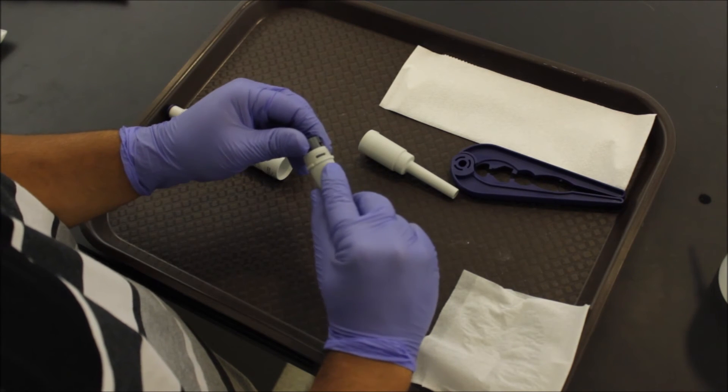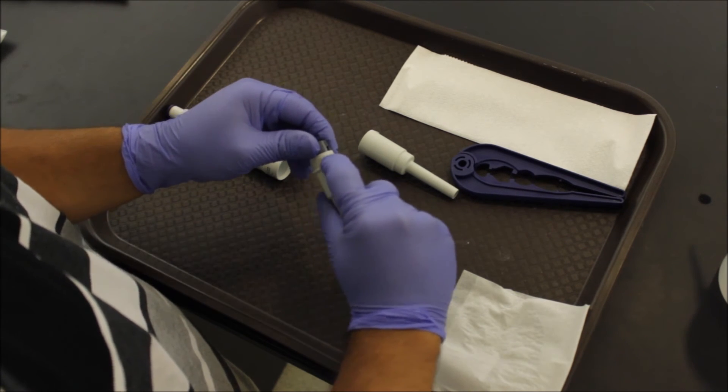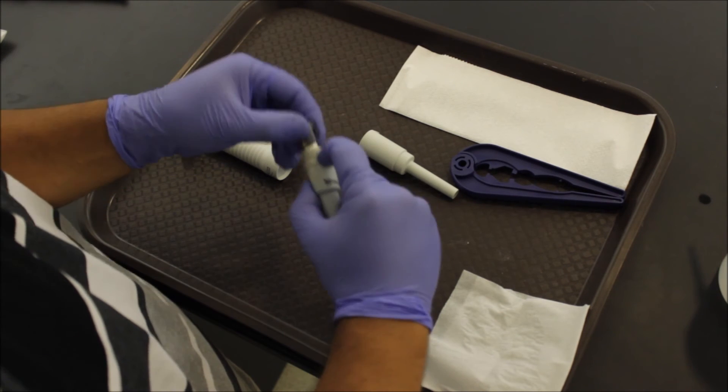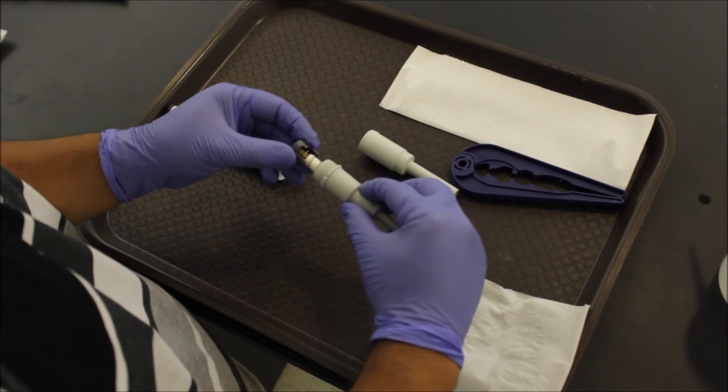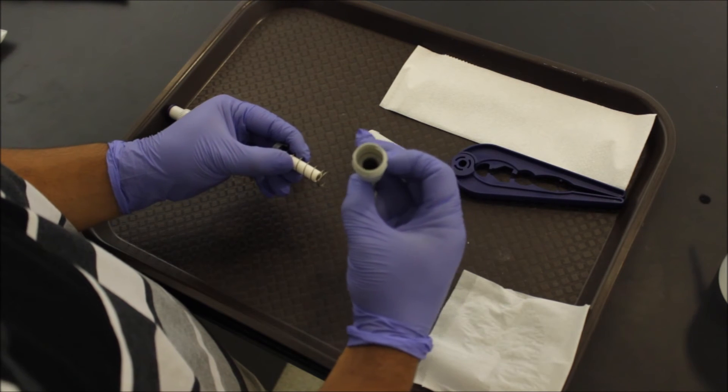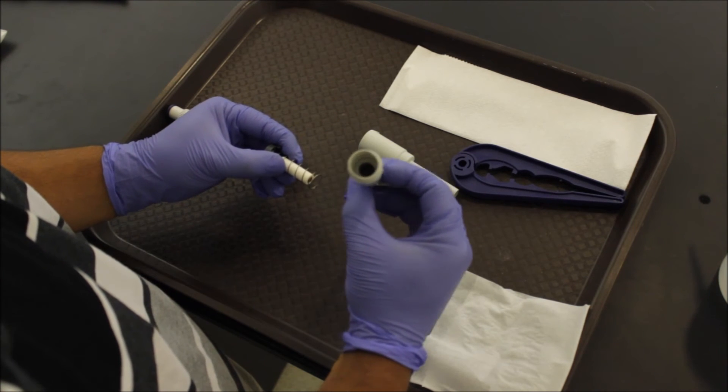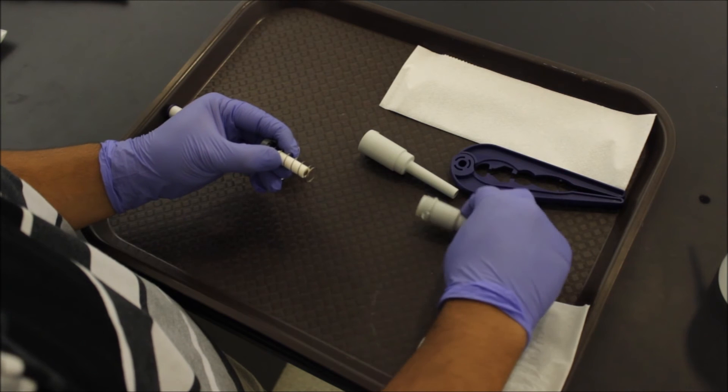Here you have two slits, which are going to pinch into these to release it. Watch out for the spring, which pops off with some force. Check the barrel for any debris. If you have some debris, use ethanol and a chem wipe to wipe it off.